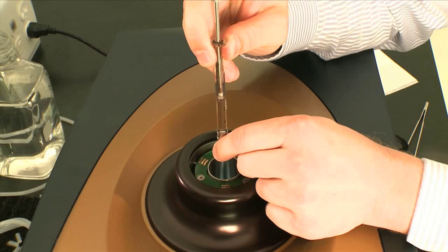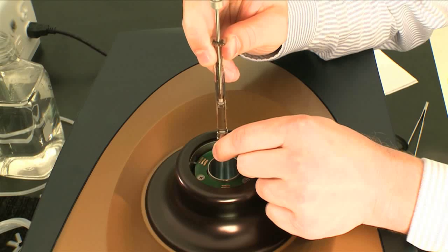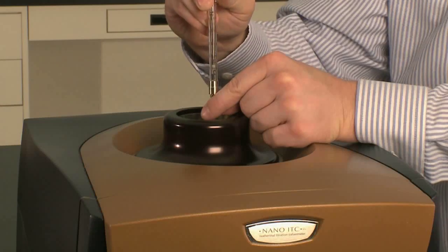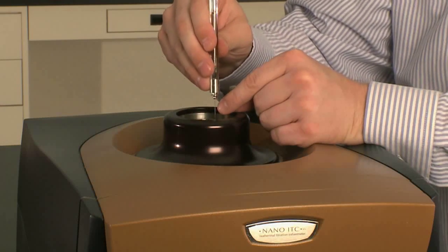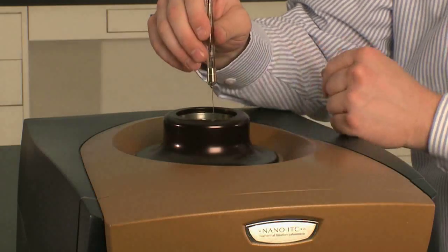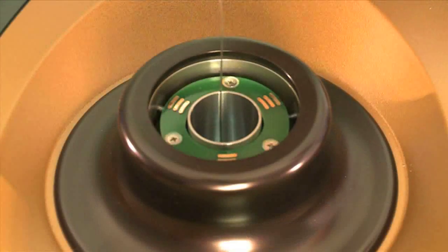I overfilled the syringe a little, and when I get down to about 300 to 350 microliters, I stop. I swirl the needle a little in case there are any bubbles that I introduced, and then I lift it out of the cell.